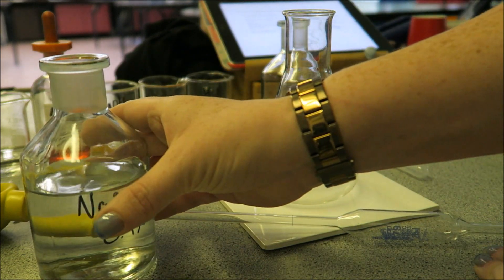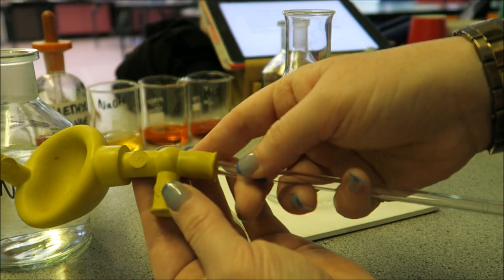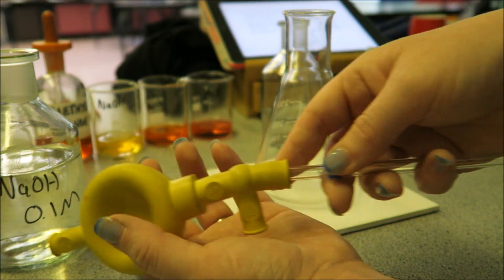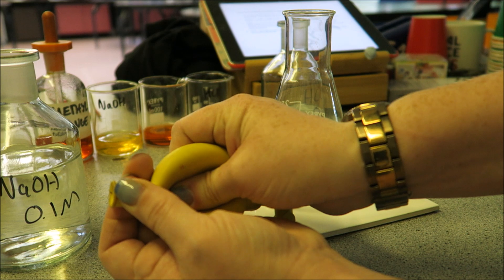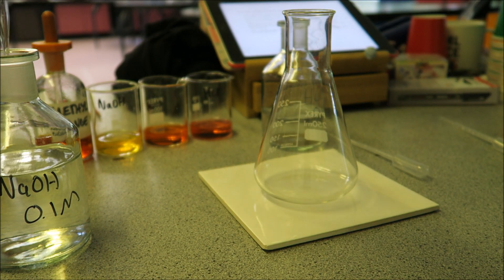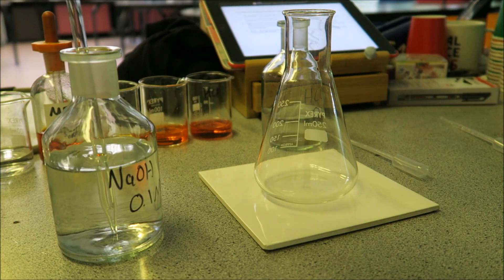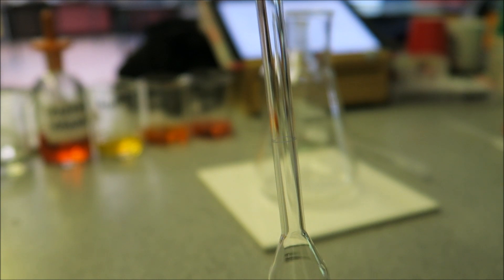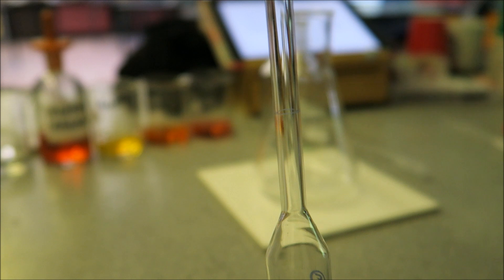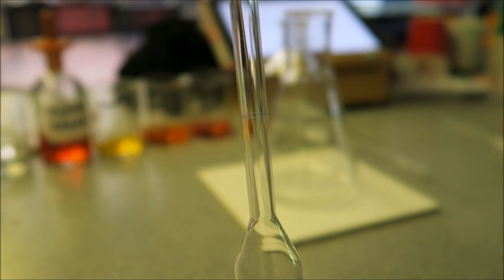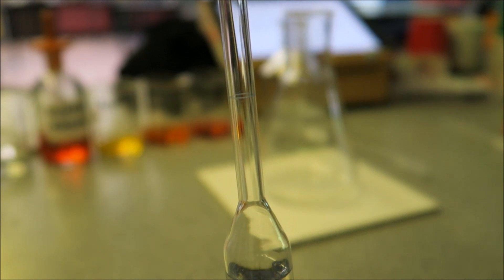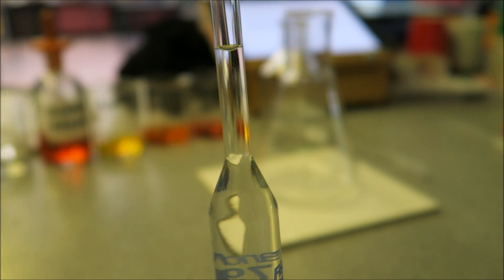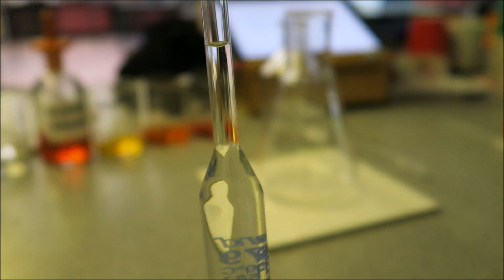Now I have my sodium hydroxide here. To suck it up, you press here, the S. That releases it, and to empty it, you press that one there. Pick up my sodium hydroxide. You need to do this slowly, carefully. You don't go over the line. Slowly, carefully sucking this up. You want it to be exactly on that little line. Once it gets past the bulb, it goes very quickly, so do it in tiny amounts until you get it there. I've had a lot of practice with this. If you don't do it first time, that's fine.